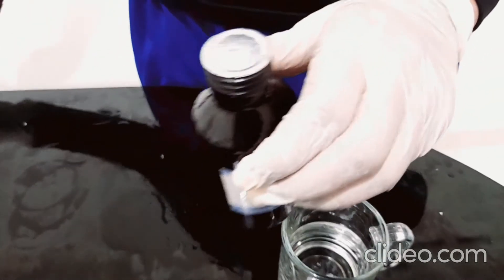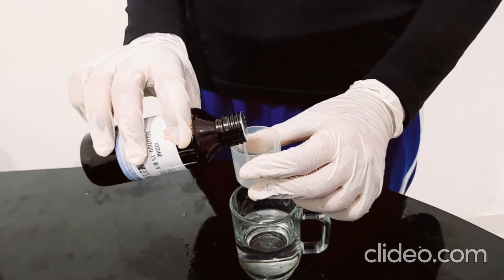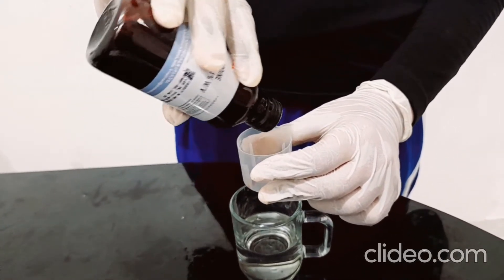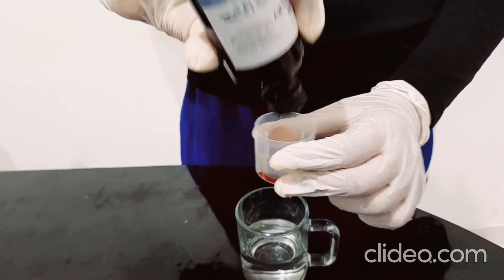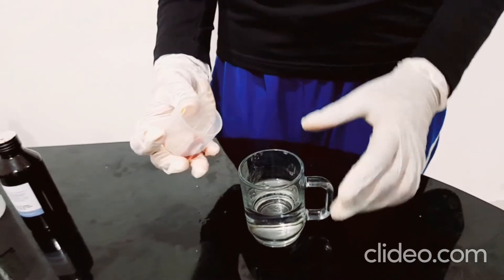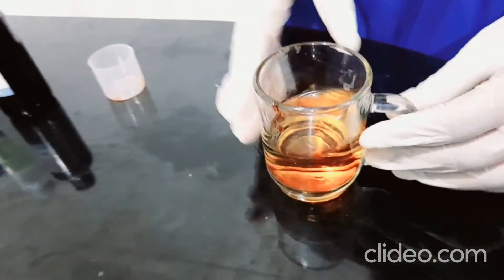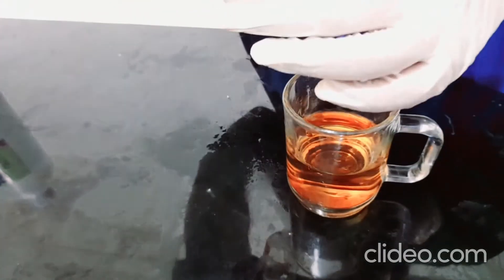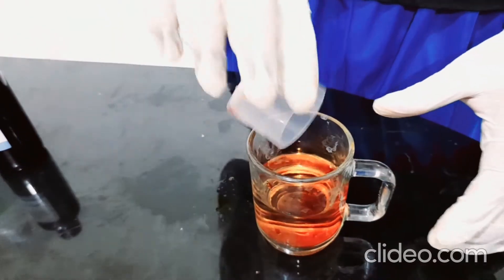I'm going to dilute the iodine solution into a bit of yellowish-orange color as needed. It's sealed on top, let me just break it open. I've made a small hole so it comes out in the exact amount I want — I'm pouring this iodine solution into the measuring cup drop by drop. Three drops, five, six, seven, eight, nine — and a few more. I have the perfect amount, so I'm just going to pour it in. Five drops more — it's perfect in color right now.